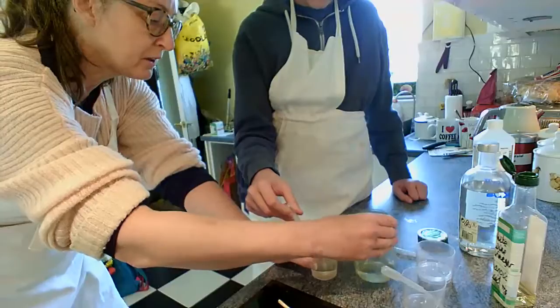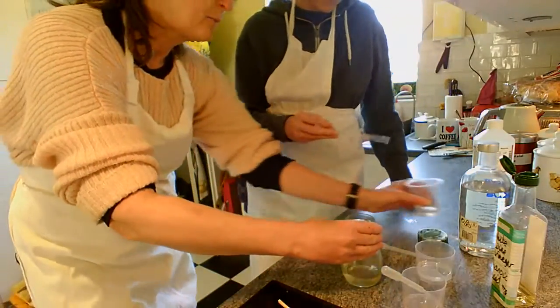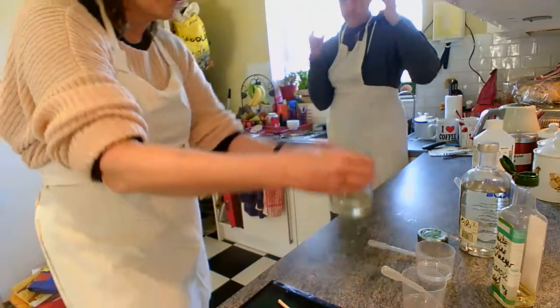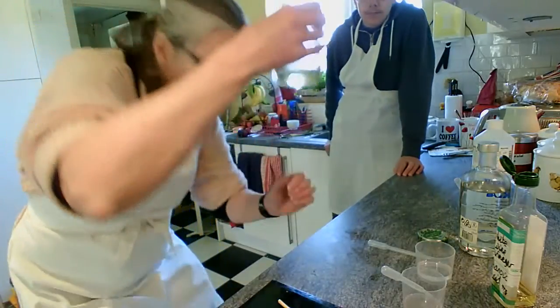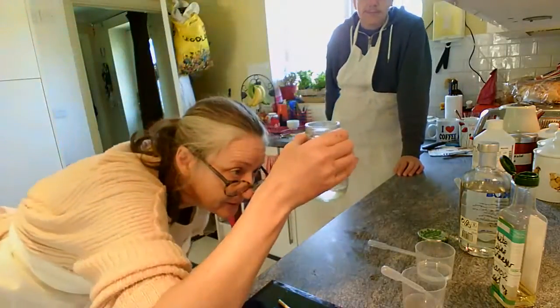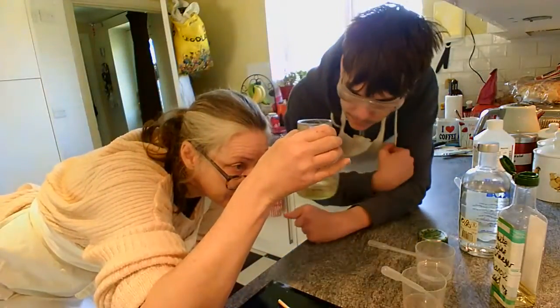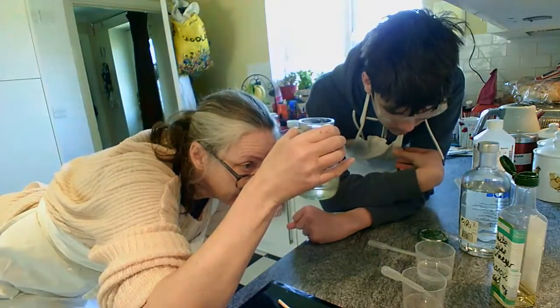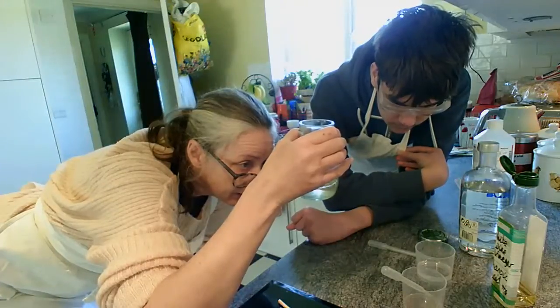Okay, shall we have a look now? So we'll give it a swish. Okay, you can stop adding. I'll put that away from the edge. Now we've got a completely different shaped beaker for that one, so we don't get them mixed up. Now, okay, I'm looking down in there and I'm seeing, firstly, we've got a colour change. And secondly, if you come down here, you can see there's a precipitate forming. Yeah. Okay. So we've got a decent precipitate forming.